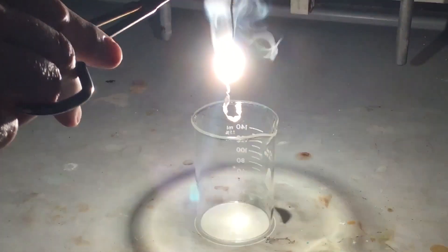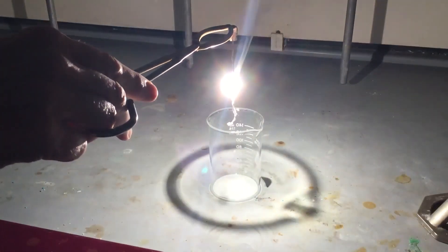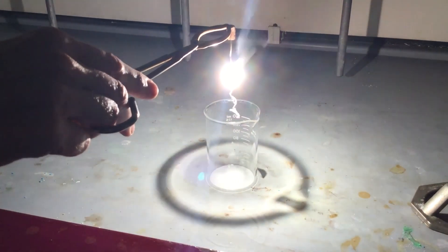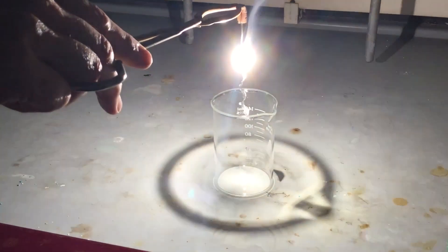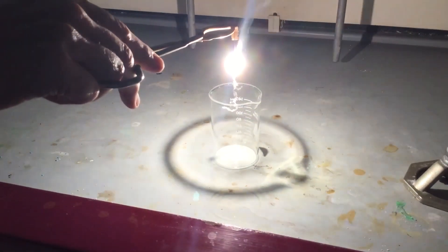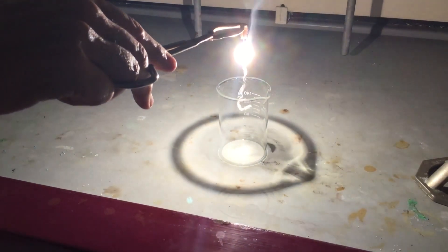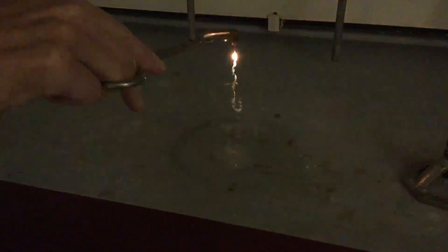This is a very high energy reaction. It's very hot — I would not put my hands in contact with this because it would give me a severe burn. But this is making a new compound known as magnesium oxide, which at the end is very safe to touch, but during the reaction is not.